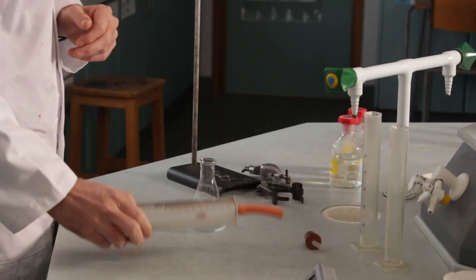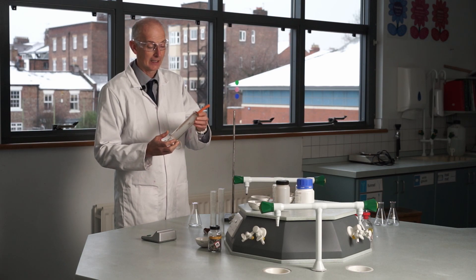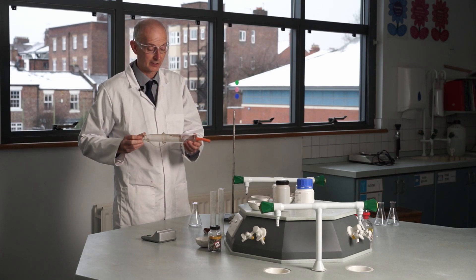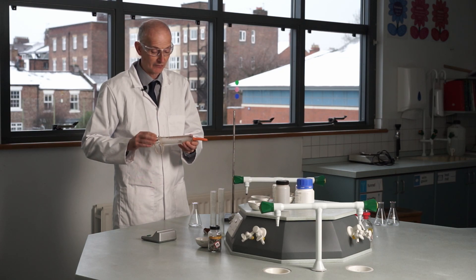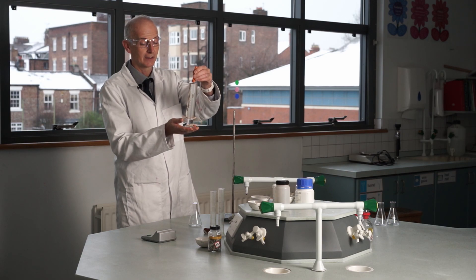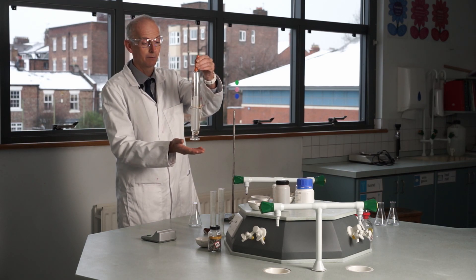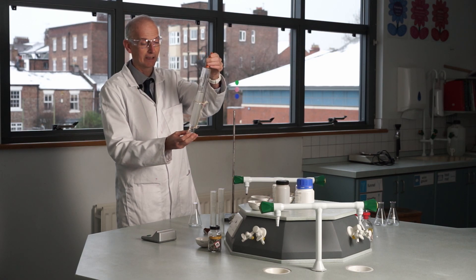And this is a piece of kit that you haven't seen before. This is a gas syringe, which is a glass piece of apparatus. It's quite chunky. And it's a barrel which moves inside a sleeve and the sleeve has got graduations on it. And it should be free flowing. So if I let go, it should move down to the bottom. It gets caught by this piece of string which stops it falling out at the end.